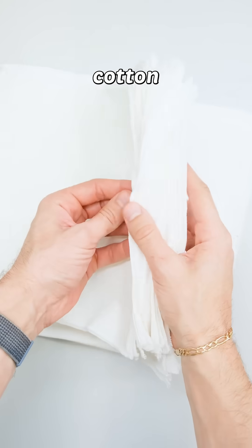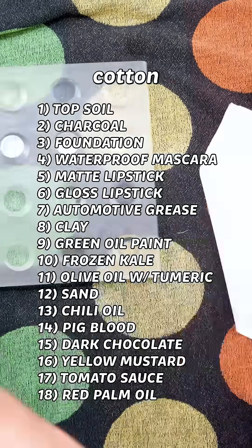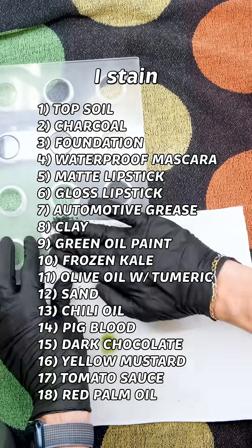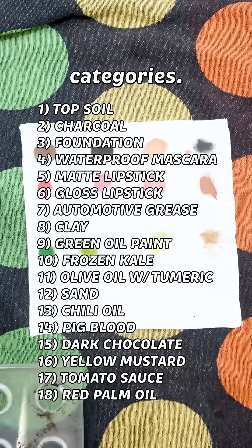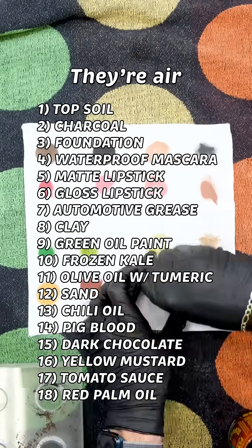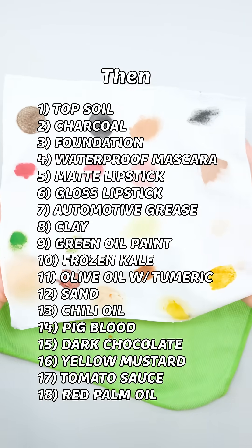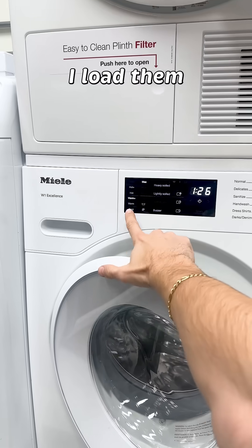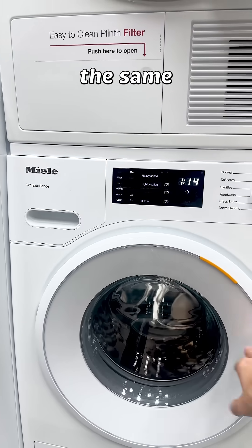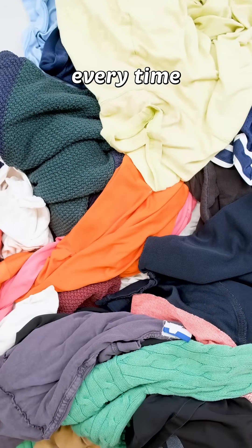Here's my fast version of the process. I buy white cotton in bulk and create one foot by one foot cotton swatches. I stain them with 18 unique stains which represent five stain categories. They're air dried and the color is measured before testing. Then they're pinned to a cloth to avoid bunching.